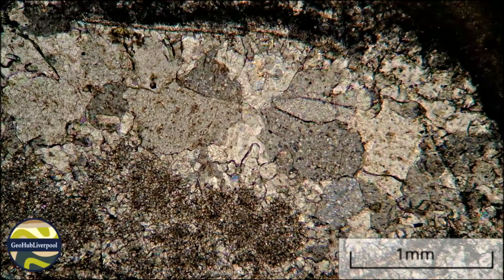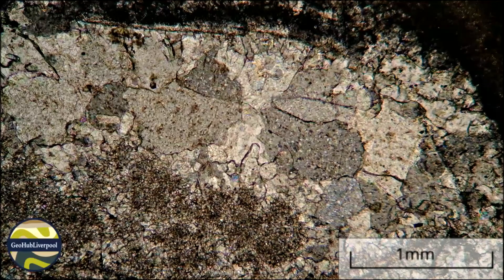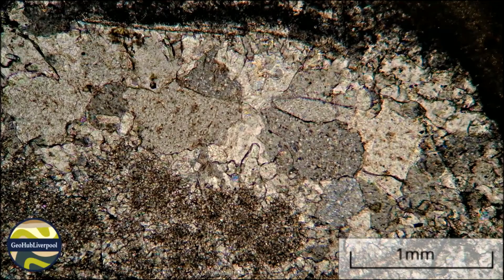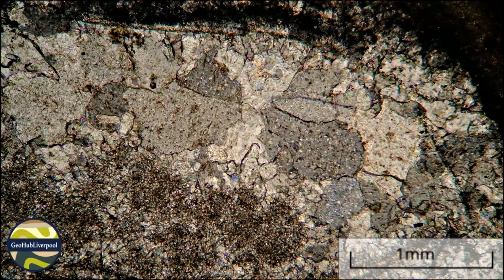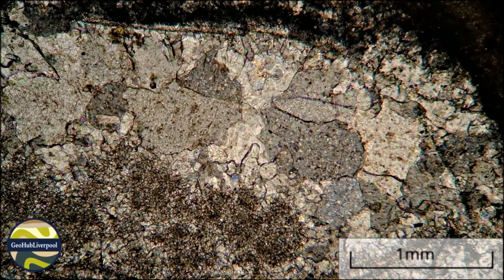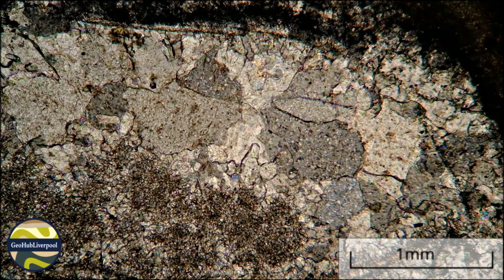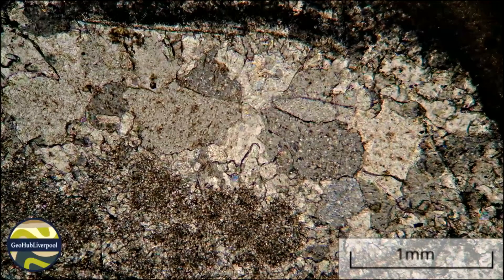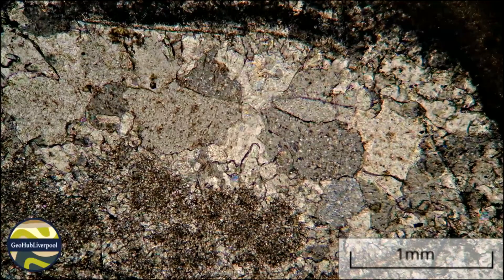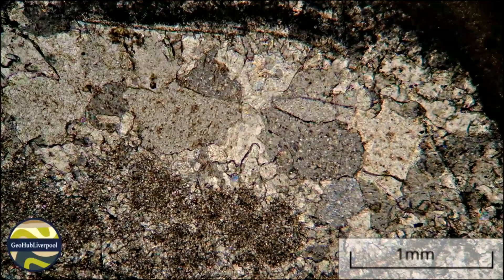In summary, this sedimentary rock is a limestone. It is composed of skeletal grains largely composed now of sparry calcite. These skeletal grains are a mixture of gastropod and bivalve shells. They are infilled with carbonate mud or micrite, and the spaces between the skeletal grains are also composed of micrite. Many of the skeletal grains are unbroken.